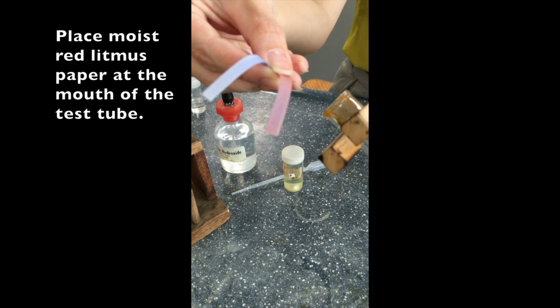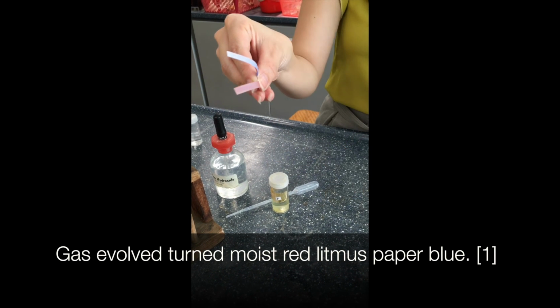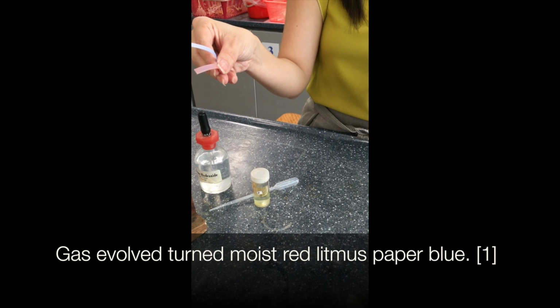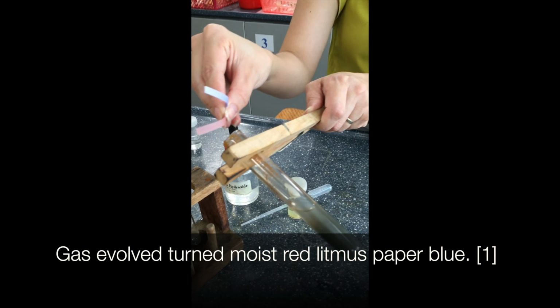So if you look closely enough, you can see that the moist red litmus paper has turned blue. So this test for ammonia gas does take quite a while to see the change.